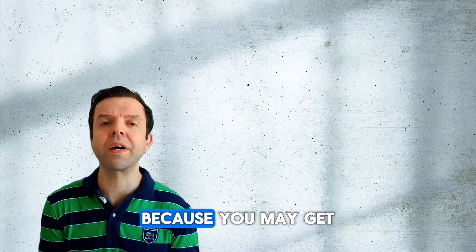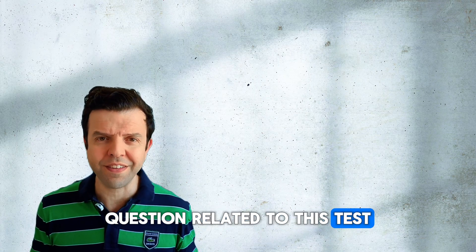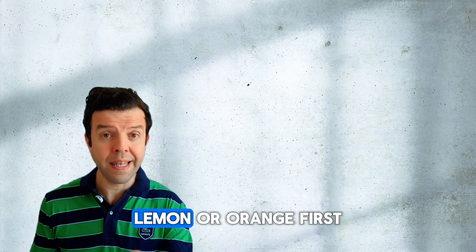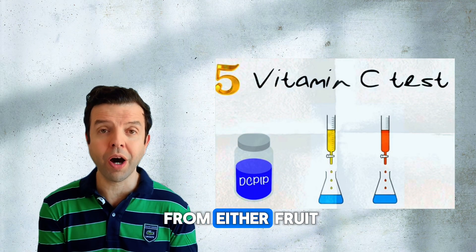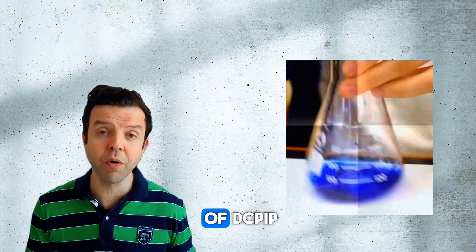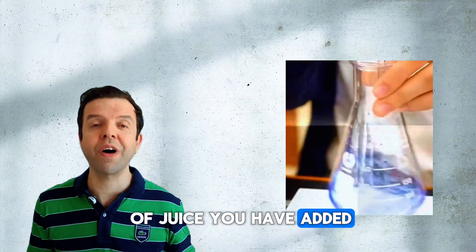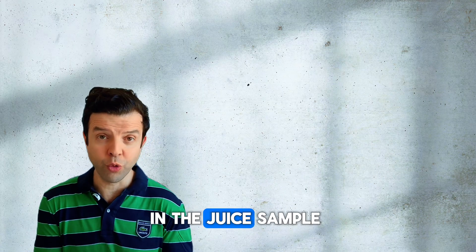The last test is the test of vitamin C. This test is quite important because you may get a whole six-mark question related to it. Let's assume you've been asked to determine which juice has a higher concentration of vitamin C — lemon or orange. First, you're going to extract juice from either fruit. Next, pour the juice onto a fixed volume of DCPIP until the color of the indicator turns from blue to colorless. The lower the volume of juice you have added, the higher the concentration of vitamin C in the juice sample.